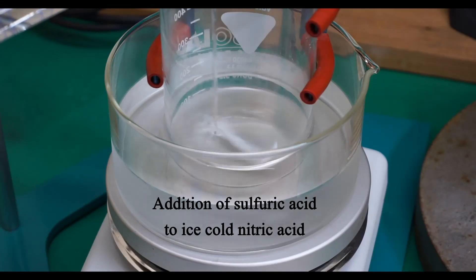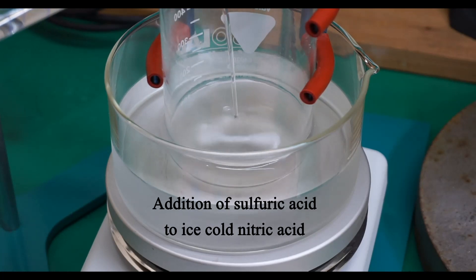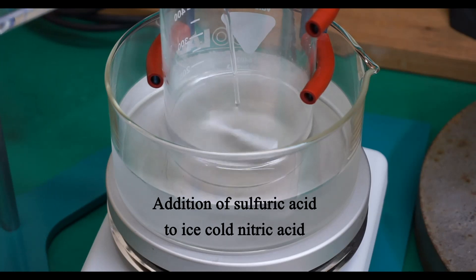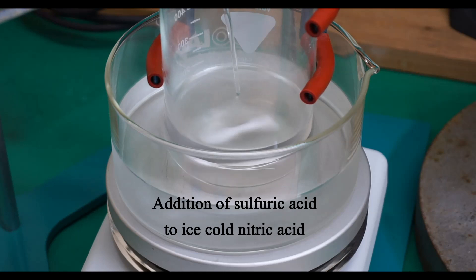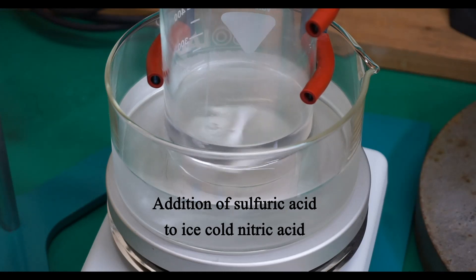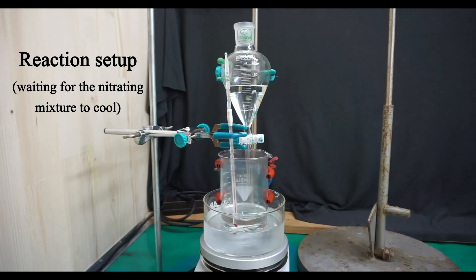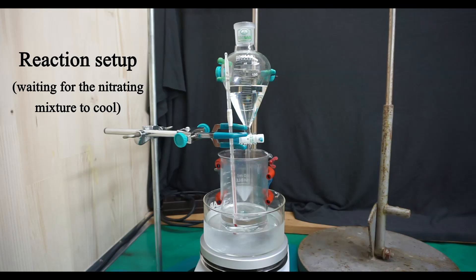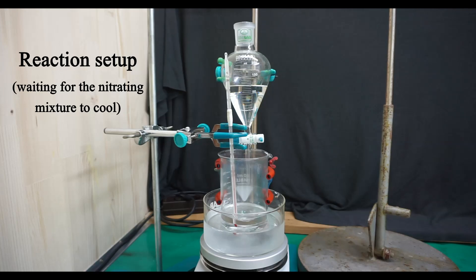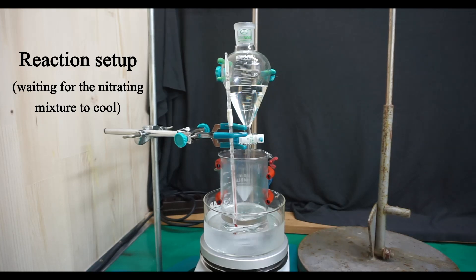I performed this reaction in a tall 600 ml beaker and monitored the reaction temperature with a thermometer. I began by cooling the beaker with the nitric acid in an ice-cold water bath. While stirring the now ice-cold nitric acid, I added the sulfuric acid. Not surprisingly, the mixture heats up, but not drastically so. After the addition of the sulfuric acid was complete, I waited for the nitrating mixture to cool again. When it was close to room temperature, I began slowly adding the bromobenzene with the help of a 250 ml separating funnel.